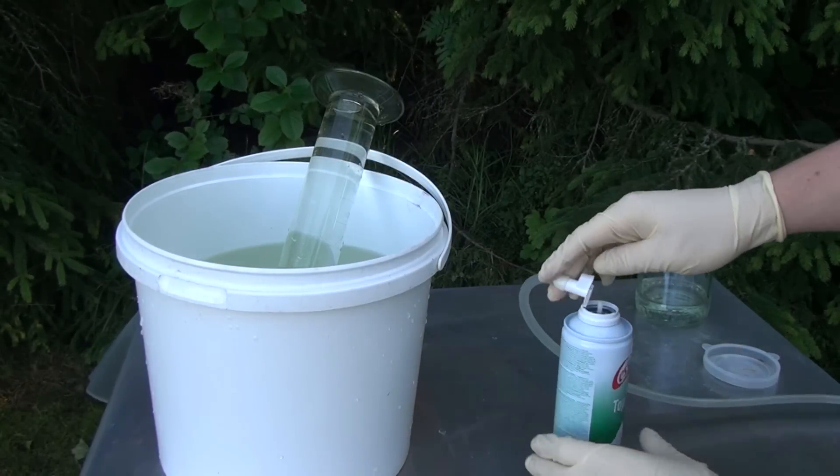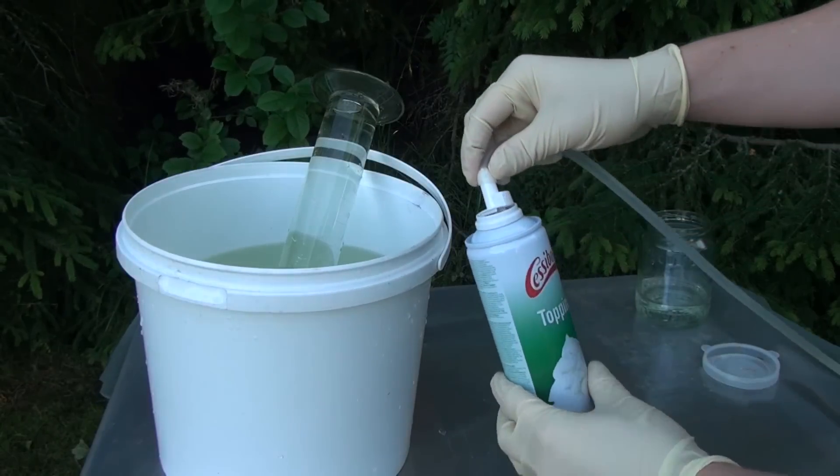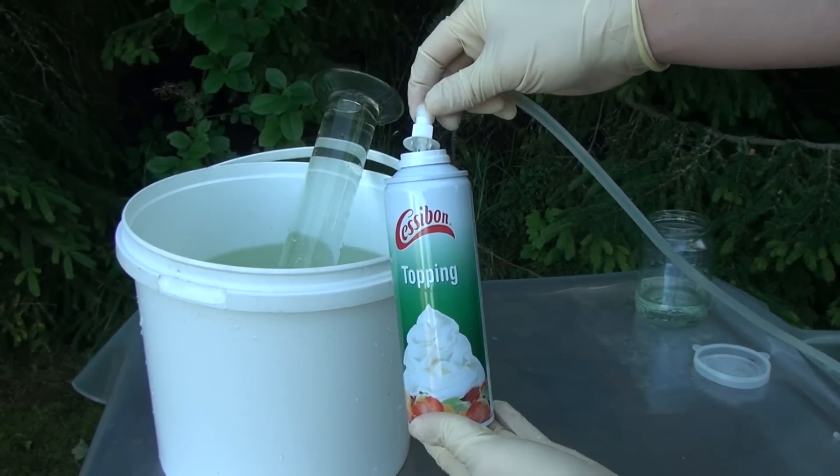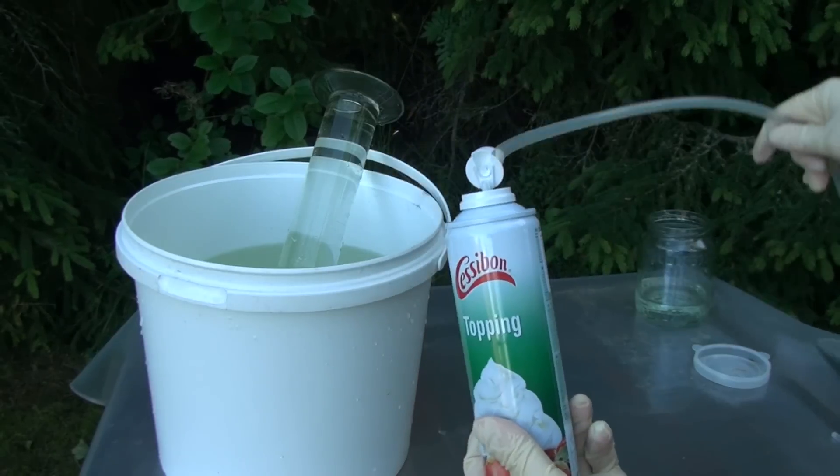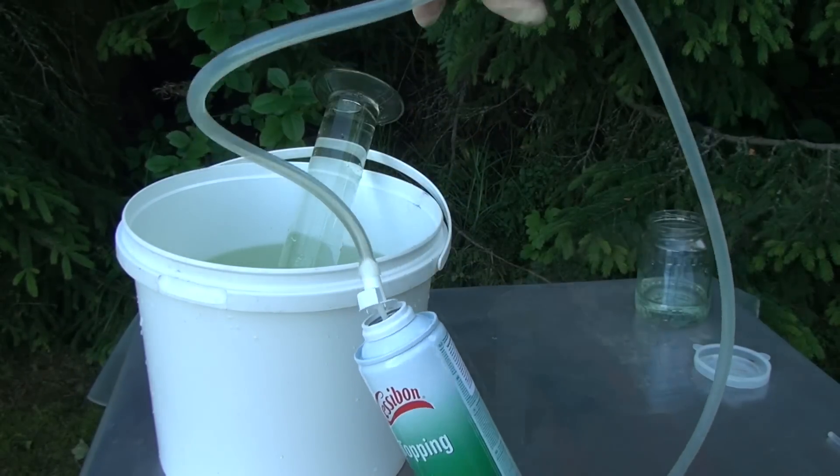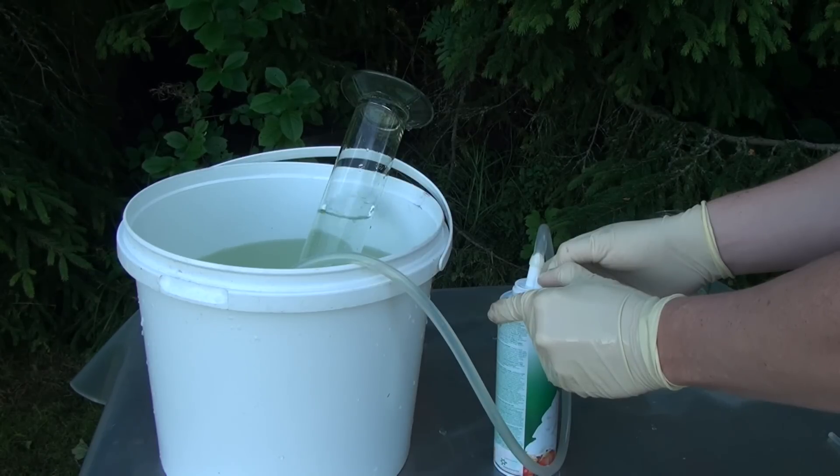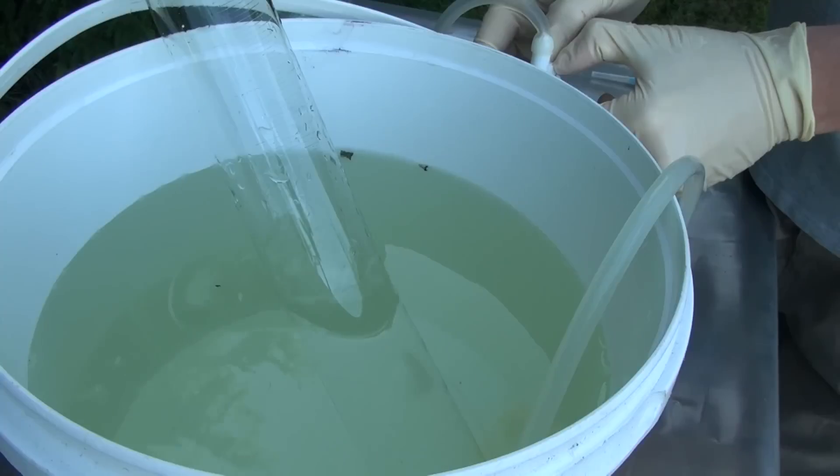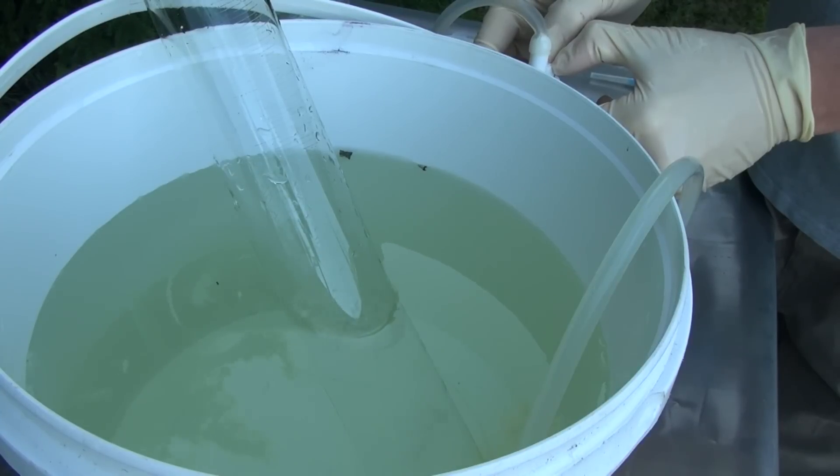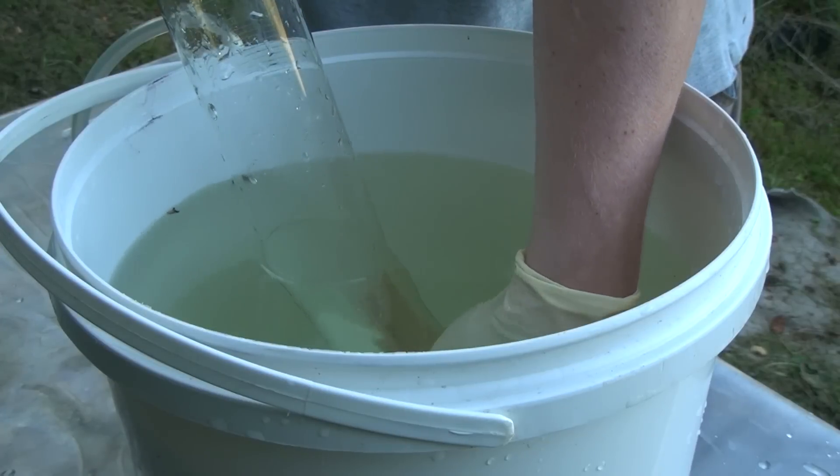However, the reaction barking dog goes even better if you use nitrous oxide. An interesting fact that nitrous oxide is contained in bottles with whipped cream which are sold in almost all stores. Nitrous oxide is released pretty easily and about 1.5 liters of nitrous oxide can be squeezed from one cylinder.